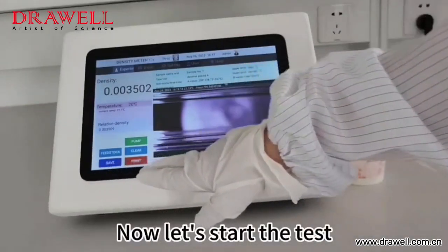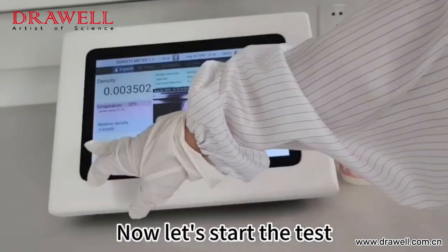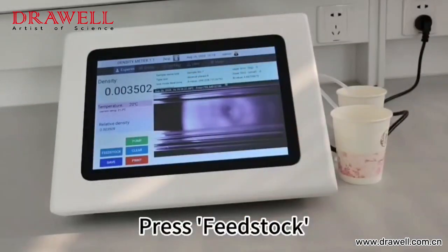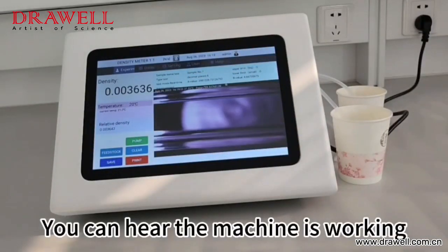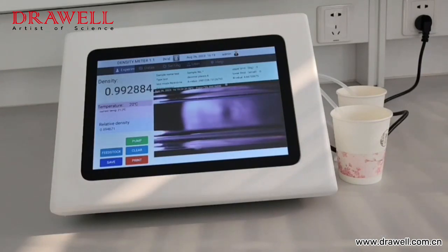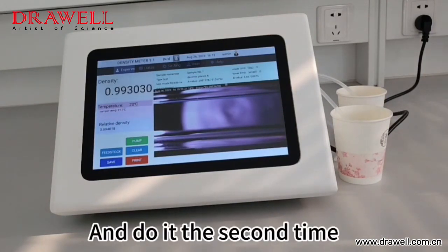Now let's start the test. Press feedstock — you can hear the machine is working. And do it a second time.